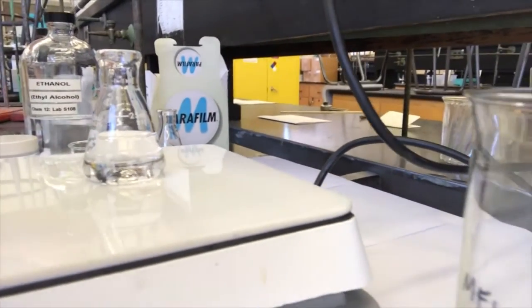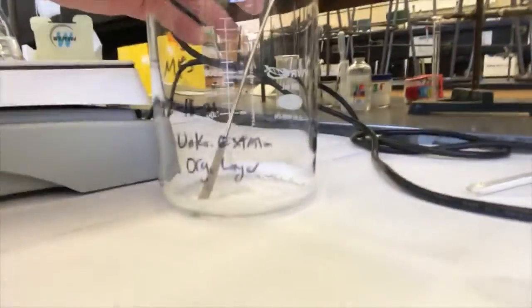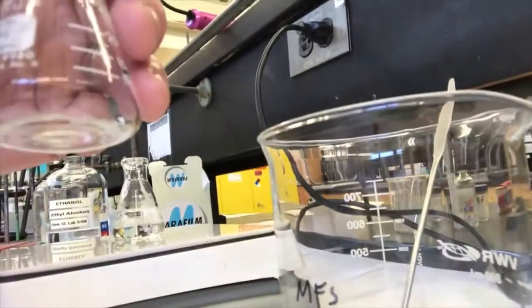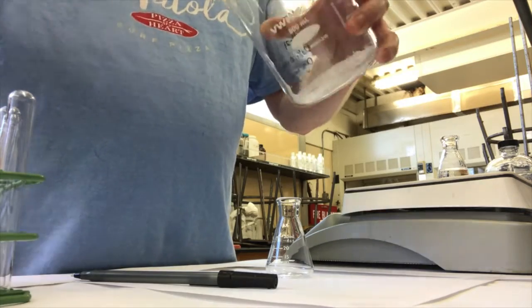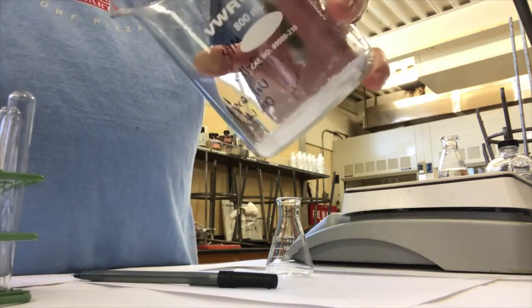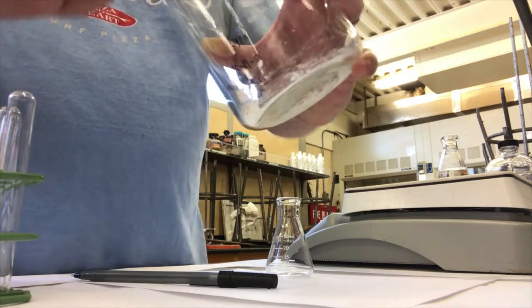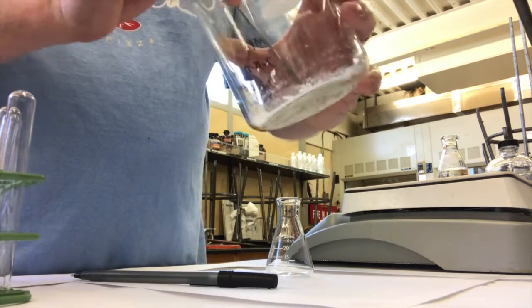And while I'm waiting for that to boil, I need to get my solid from this big beaker that I had the organic solvent evaporate away from. I've got to get that solid into this little guy. I'll show you how I do that. I just scrape around the solid in the beaker and try to get the majority of it out this way into the Erlenmeyer flask. There'll still be a fair amount of solid left in here after I do this, but it's okay because I plan to get that out too.